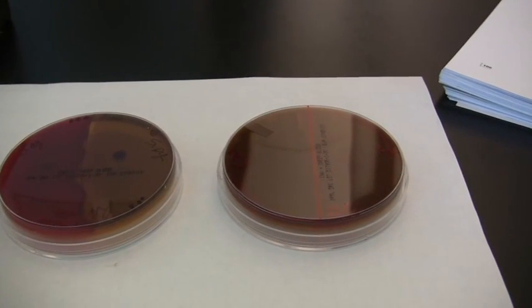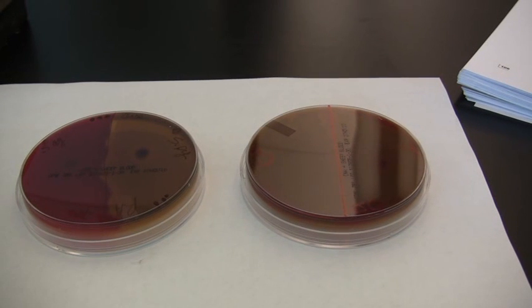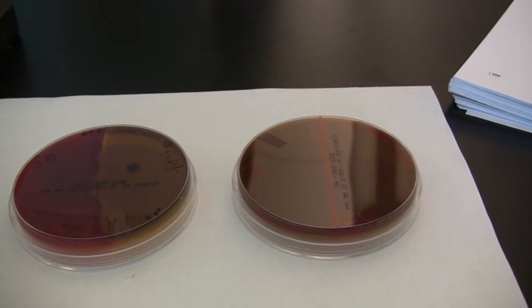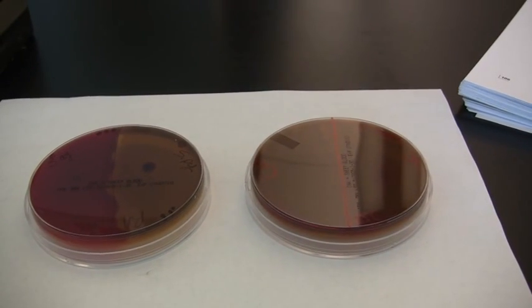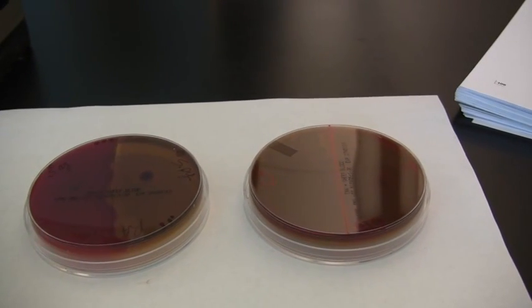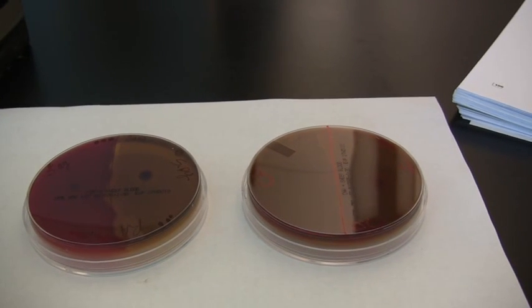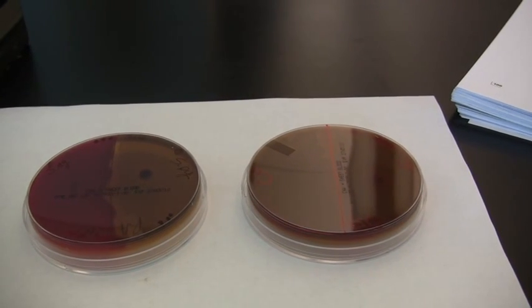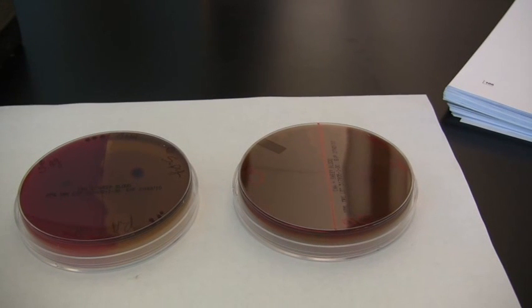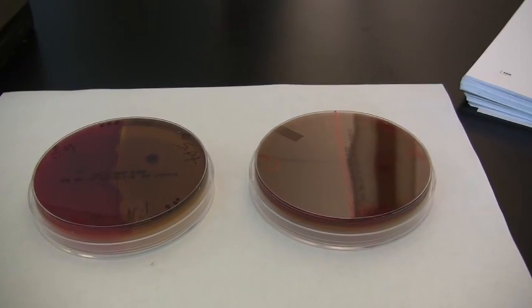This video gives an overview of CNA with blood, so we'll be reviewing the aspects of that plate and also screening for antibiotic resistance or sensitivity. Remember that CNA stands for colistin nalidixic acid. That is a selective ingredient that prevents gram-negative organisms from growing. So anytime you see any growth on these CNA plates, the organism is gram-positive.